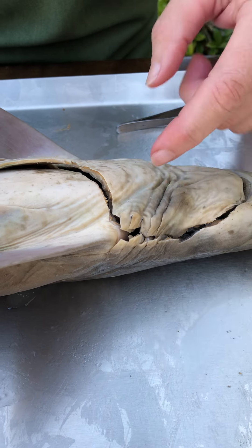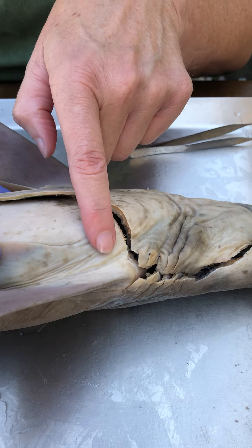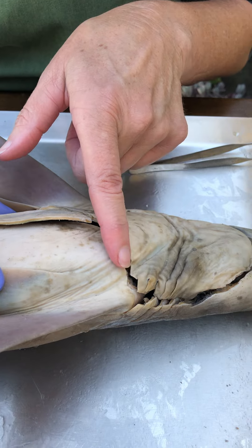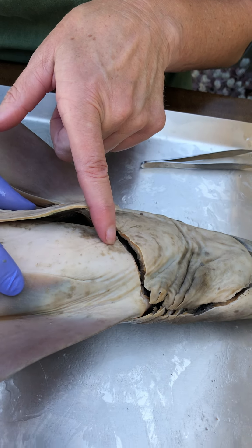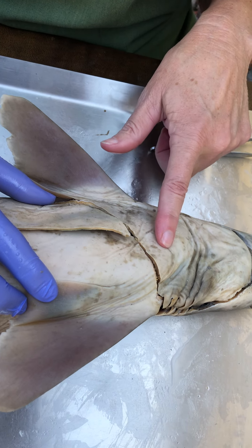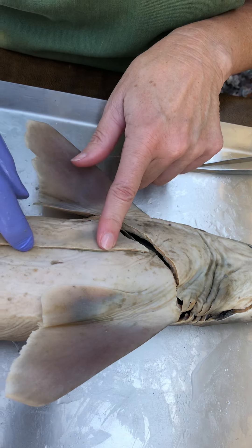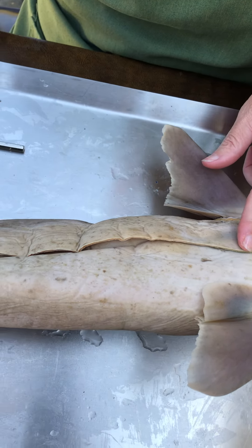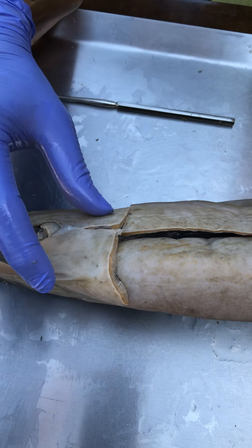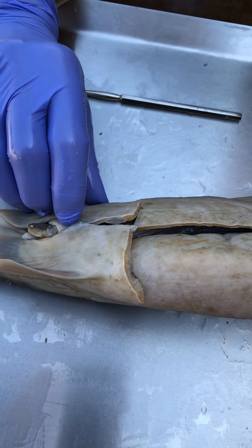Then cut through the pectoral girdle, which is homologous with our shoulder girdle. You actually have to cut through that and then take a line to the midline, angling a little bit posterior so you miss the heart, because the heart is actually sitting right here. Then you can cut all the way through the body wall. You're going to hit a little impediment here at the pubo-ischiac bar, which is homologous to our pelvic girdle, and then all the way down to the cloaca.